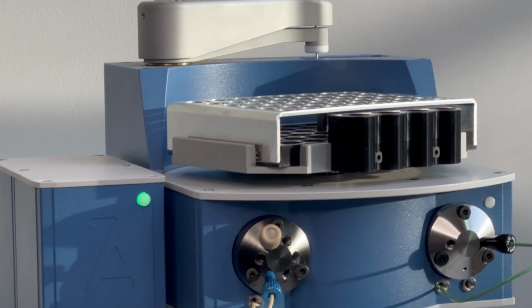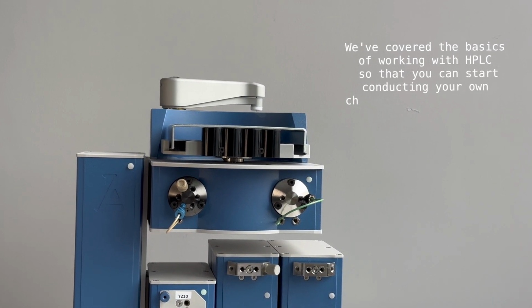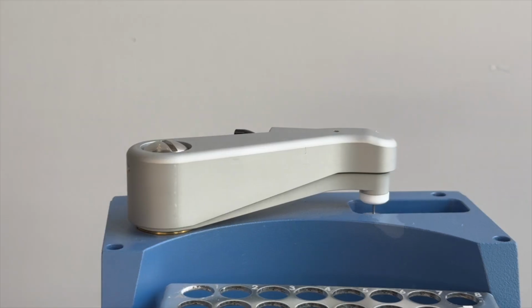That concludes this guide. We've covered the basics of working with HPLC so that you can start conducting your own chromatographic analyses.